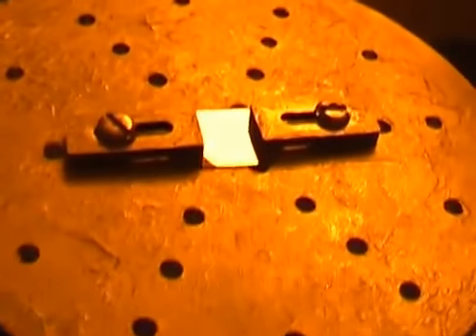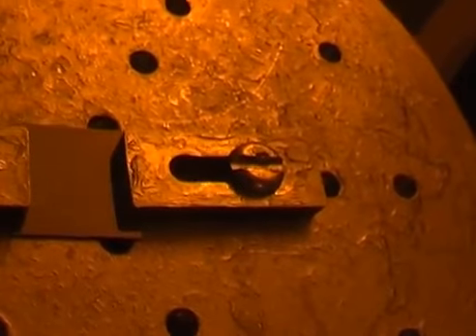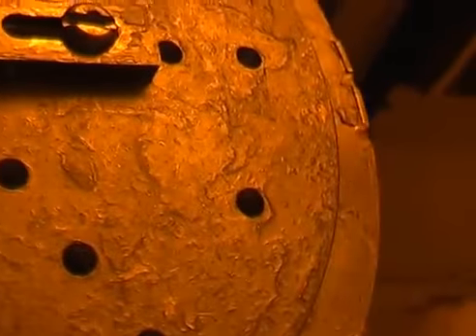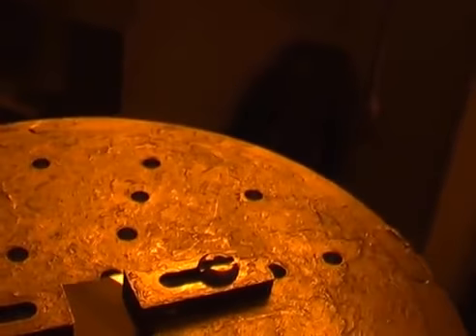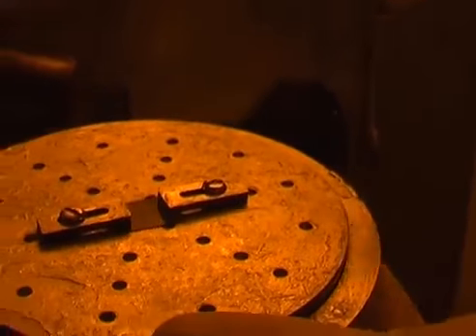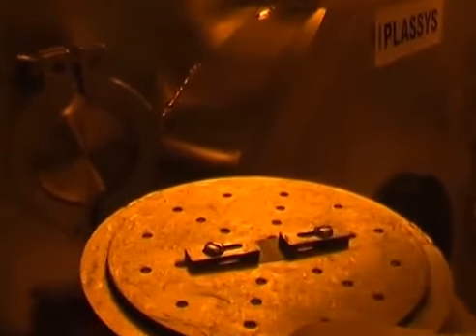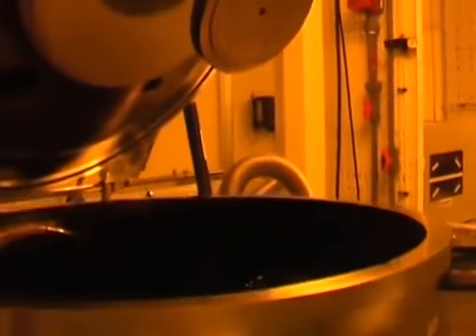You can see that now the sample holder is all gray because of the 50 nanometers of aluminum that I have deposited onto my sample. You will see it even in a clearer way once I take the clamps off, because you see that the clamps have actually acted as a mask on my sample, so you will see a different area.